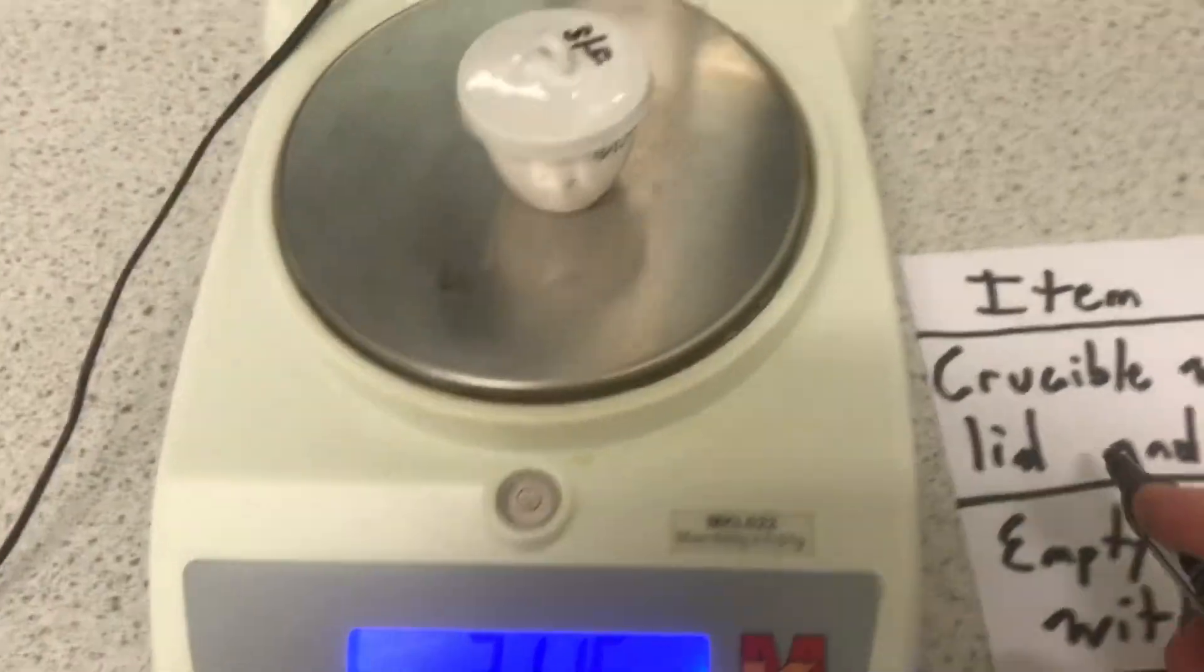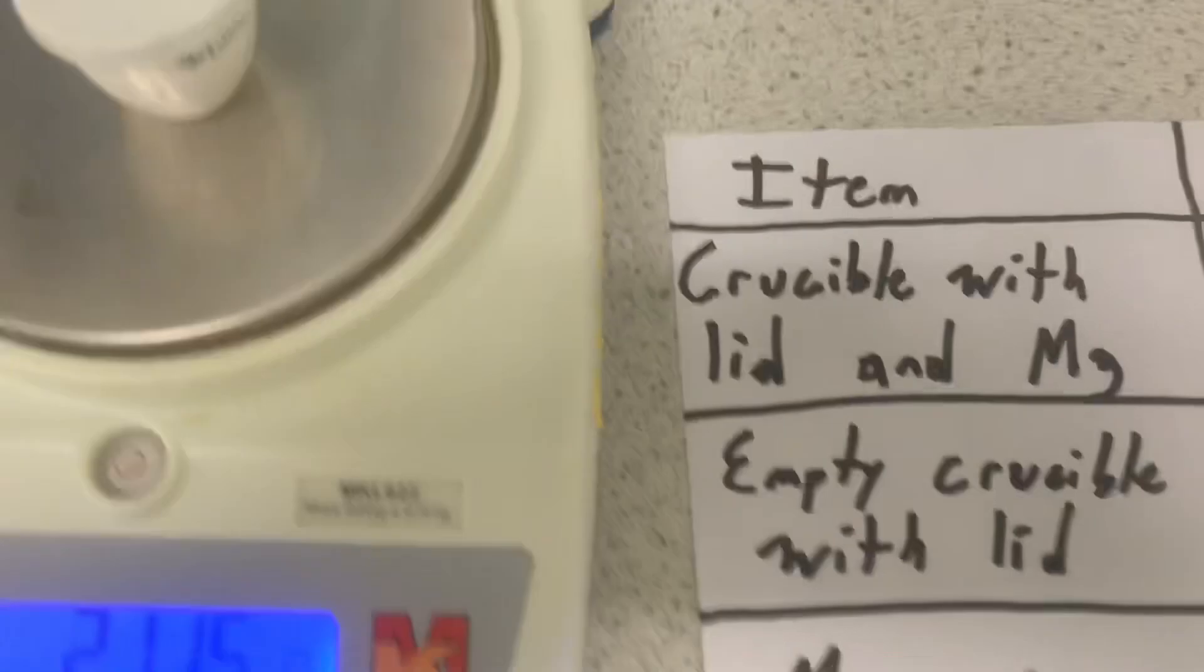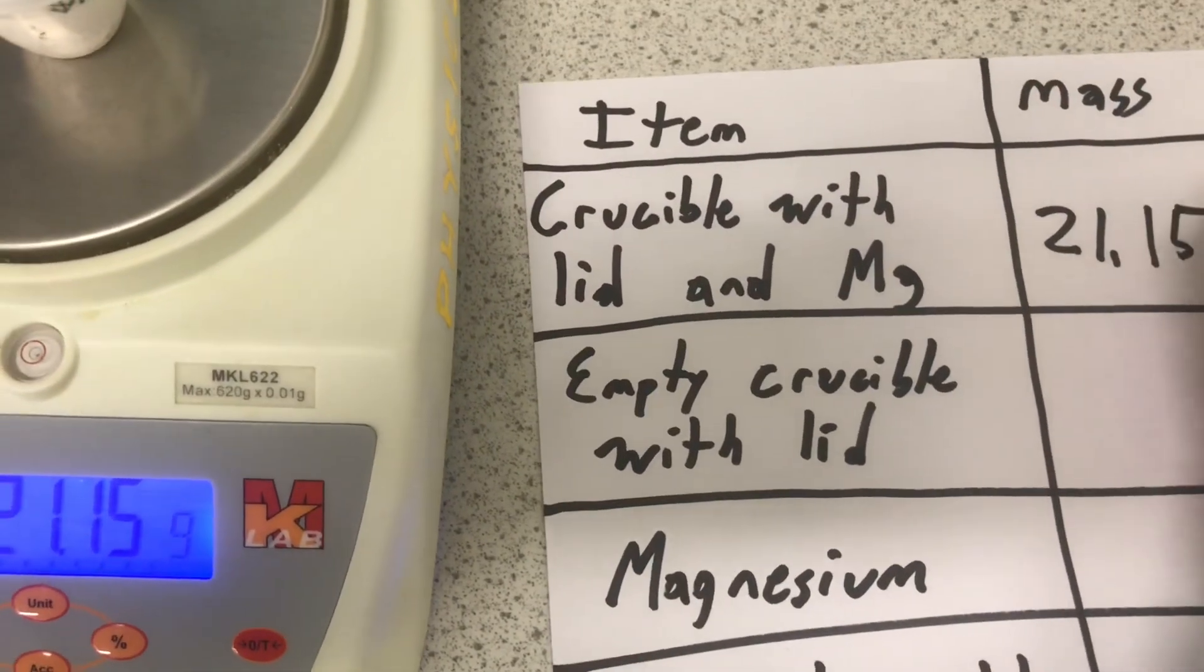Where it says crucible with lid and magnesium, I will write 21.15 grams.